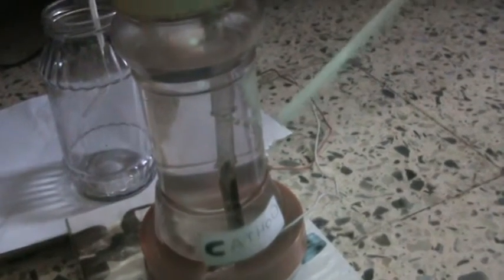We can see the hydrogen gas bubbles forming very quickly. At this side, the red wire connects to the anode. Same as the cathode, it is also joined to the lead, and this lead is going upwards.